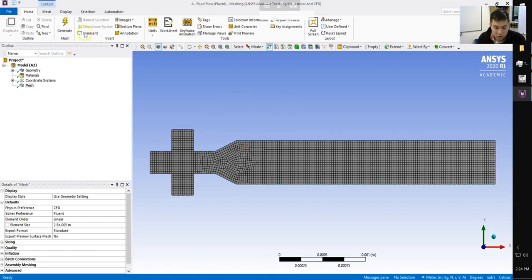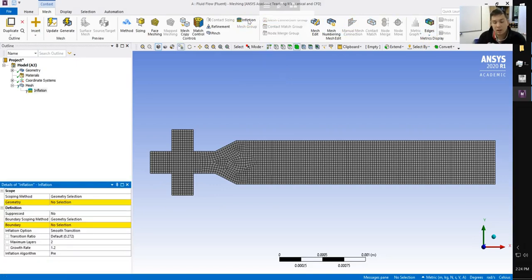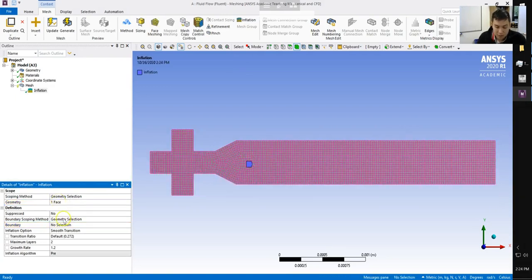So what we're going to do is go to Mesh, and then notice here is an option called Inflation. Inflation applies a layer of boundary cells next to whatever designated wall you want. So the geometry or the surface that we have to select is our full domain. We apply this. And now it's up to us to select which boundaries we want to apply this to. So we're going to apply it to all of our boundaries that are not inlets or outlets. So for reference, we have our oil inlet, our two water inlets up top and bottom, and then on our far right end, that's our outlet.